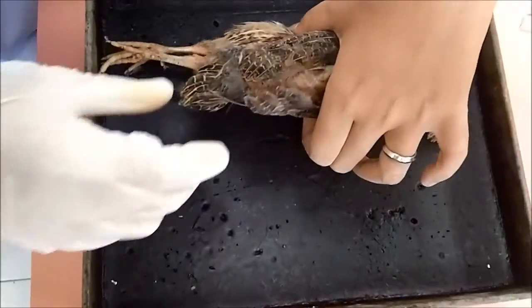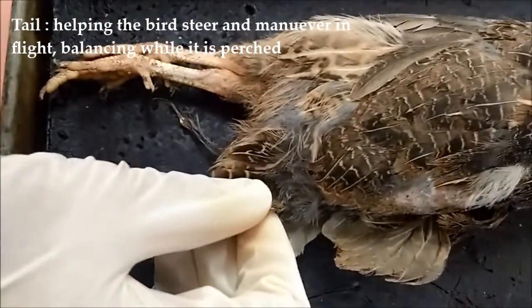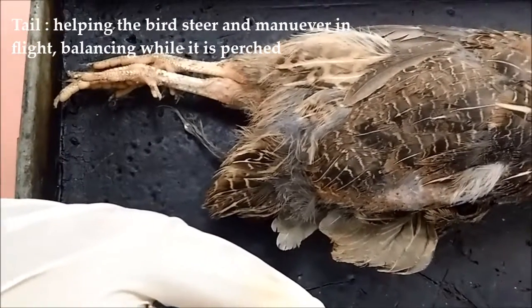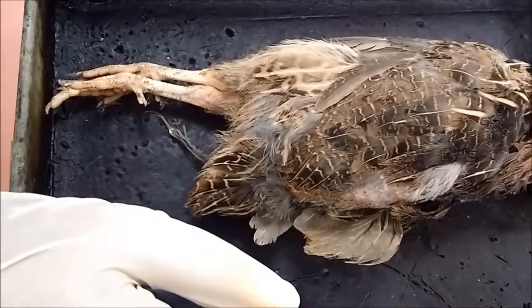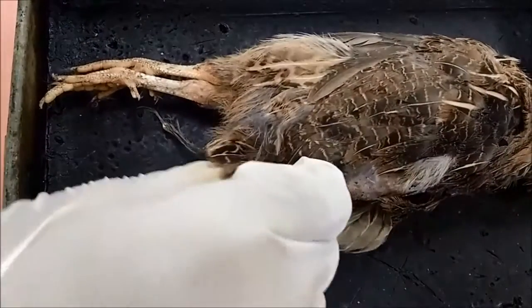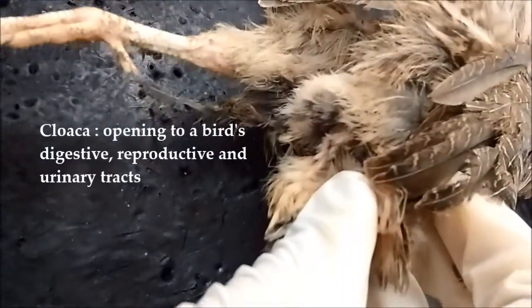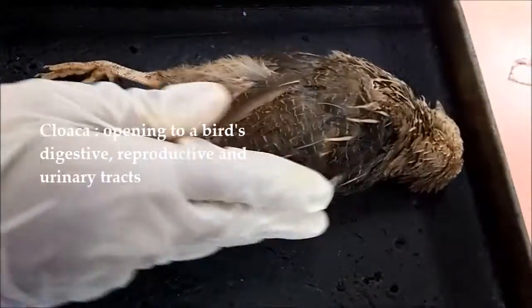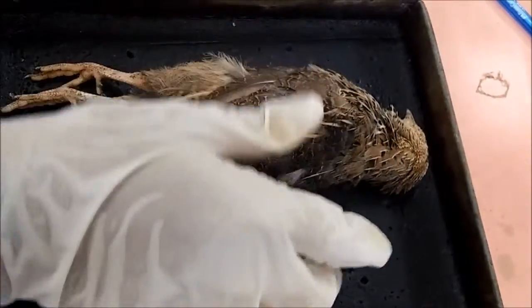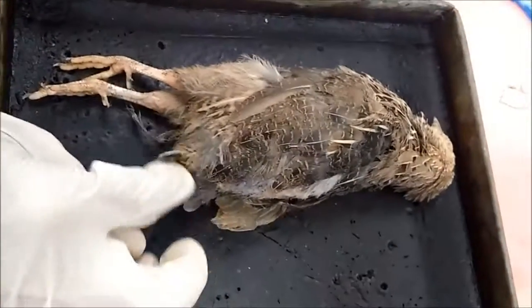You can see this is the tail. The tail is extremely short, with rectrices, a circle of large feathers. A transverse cloacal opening is beneath the tail. This is the cloaca, combining the opening of the digestive, excretory, and reproductive systems. So basically, all 3 systems, digestive, excretory, and reproductive, open here.